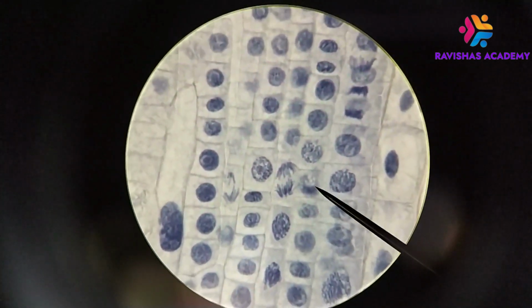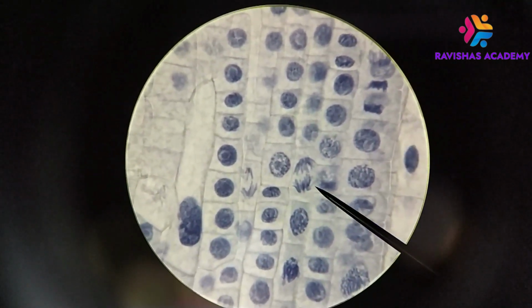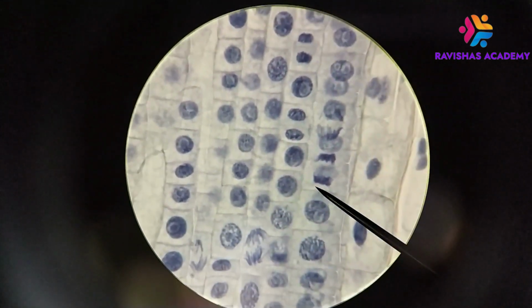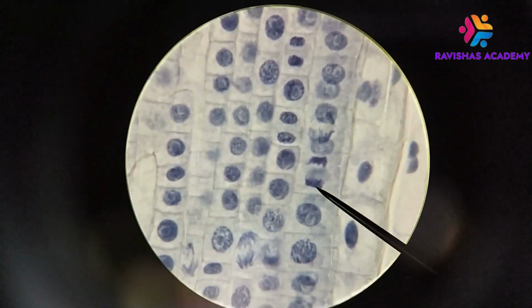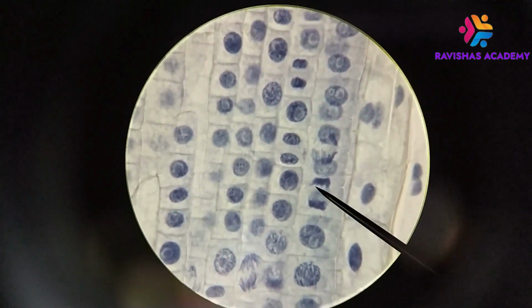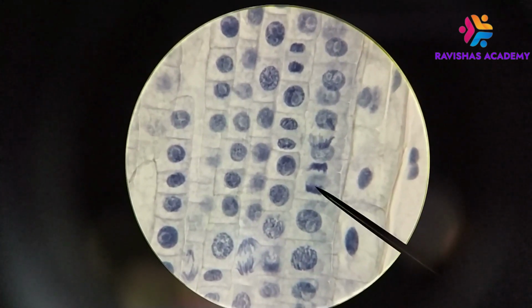And then when they do separate, they do this. So that is the anaphase stage. Now that's relatively early in this stage, and here we're starting to see that the chromosomes have been separated to opposite poles. So in this cell here, we have two poles with chromosomes at either end. Okay, and so what we're seeing here is an early telophase or a late anaphase.